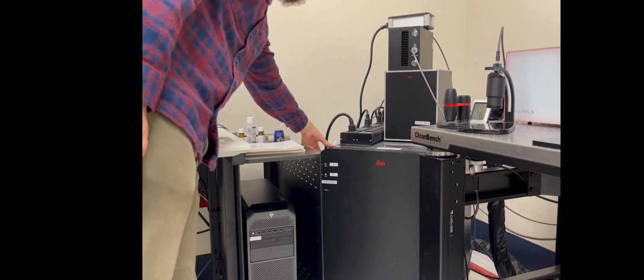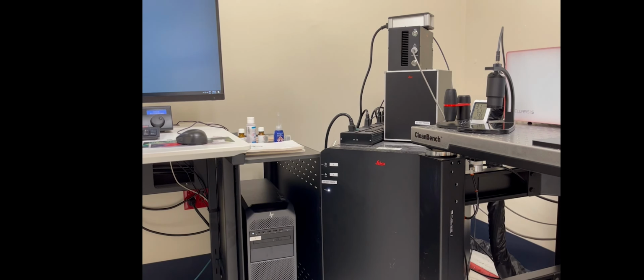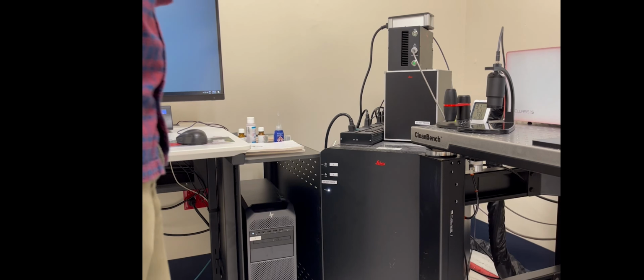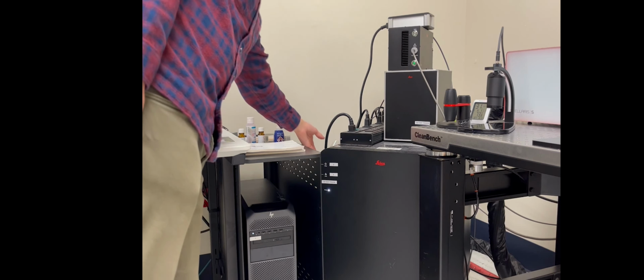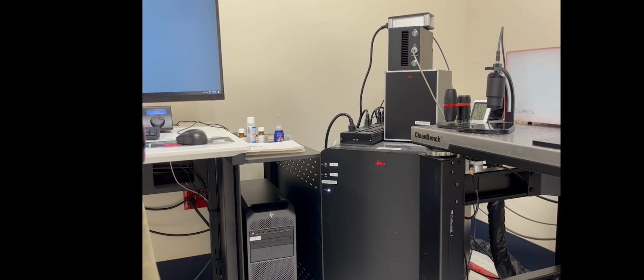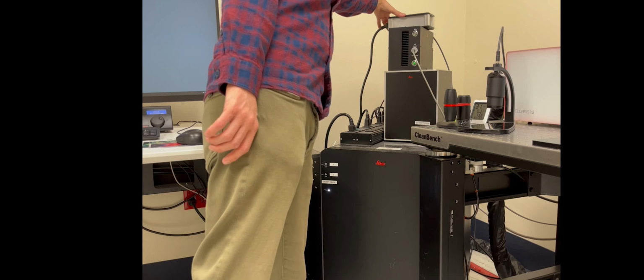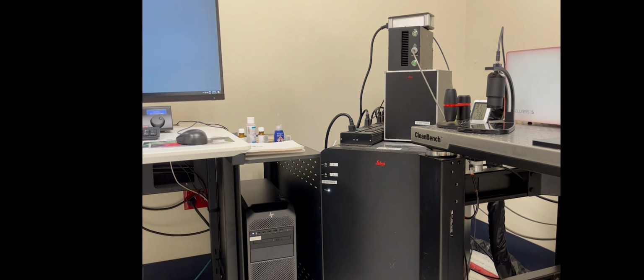Now I'll turn on 2 and 3, and that's the switches on the side of the black box in the corner. And I just turn on 2 and then wait a second and then turn on 3. And that's turning on the microscope and then the lasers. And then the fourth thing is this small box at the top and the switches on the side. And I just turn that on and then wait a few minutes till everything starts up, and that's everything ready to go.